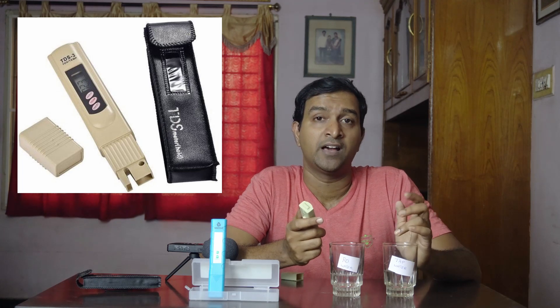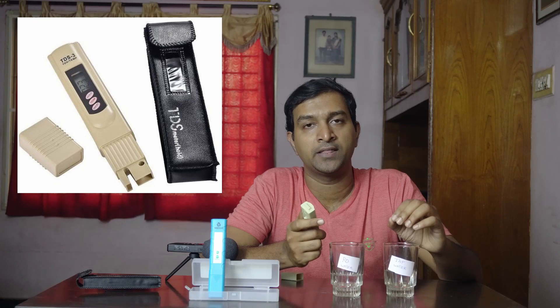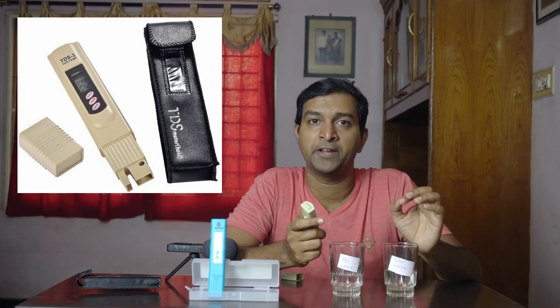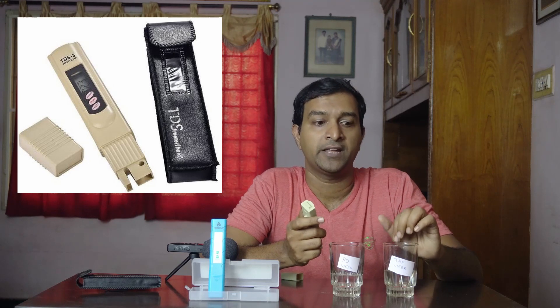From this, you can understand the technologies. There are bacteria and elements — metals like arsenic, iron, zinc, etc. These metals exist in water. We are measuring contaminated water using the TDS meter.